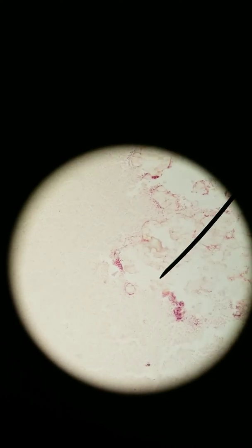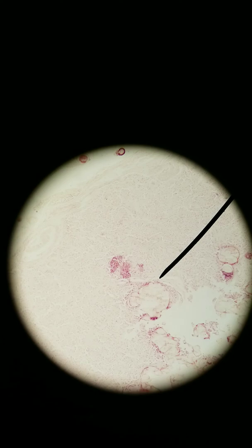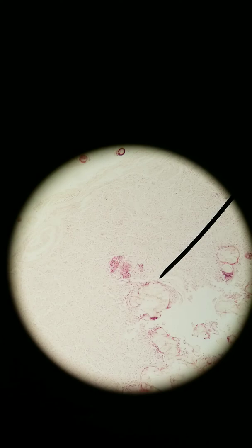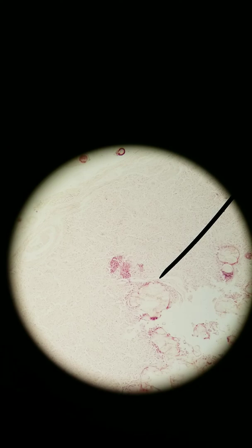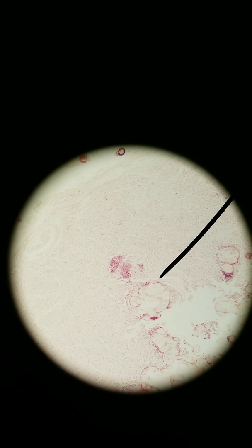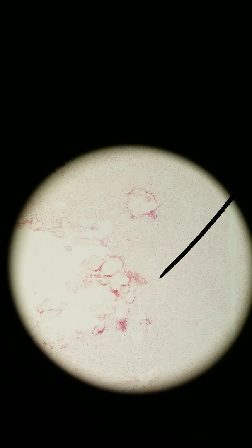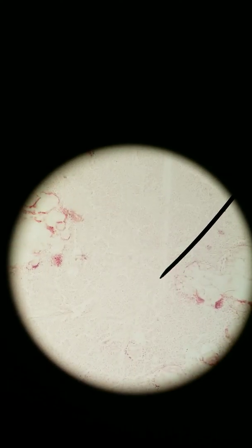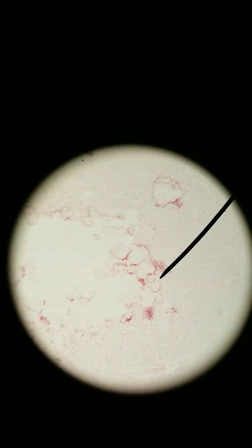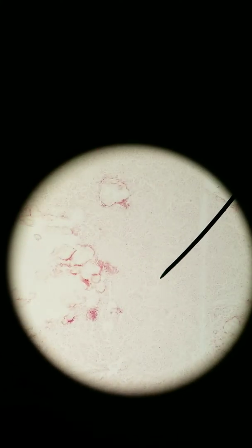So really, that's what I want you to use as a landmark to help recognize that this is the pineal gland. If you see brain sand — if you see these weird crystalline things spread throughout a bunch of unremarkable cells — you're in the pineal gland. That's really it. Pineal gland: you've got pinealocytes and glial cells, but you've also got this brain sand. It produces melatonin.